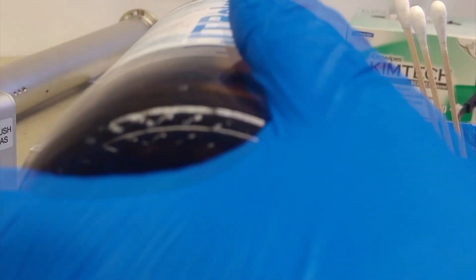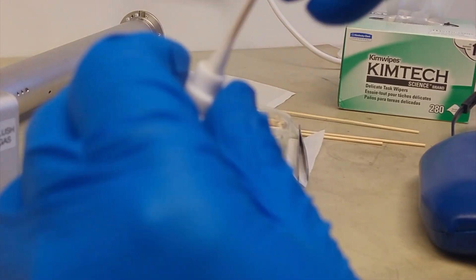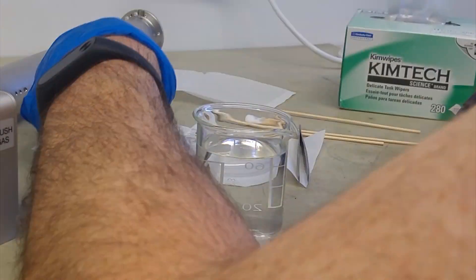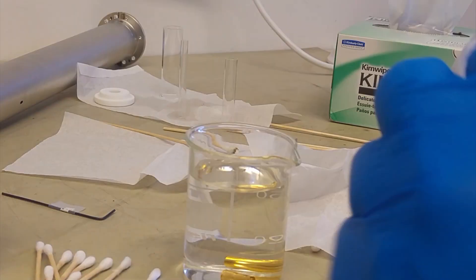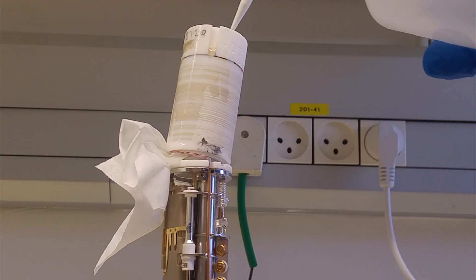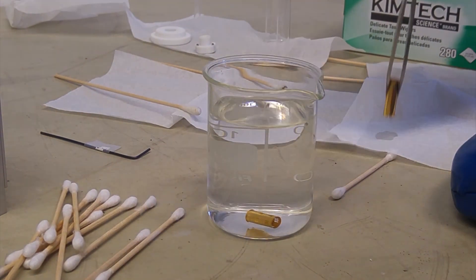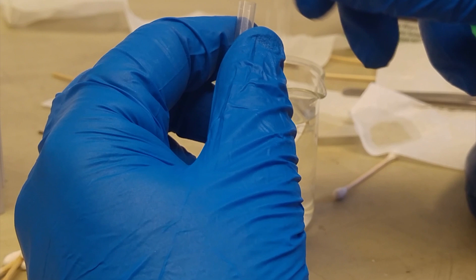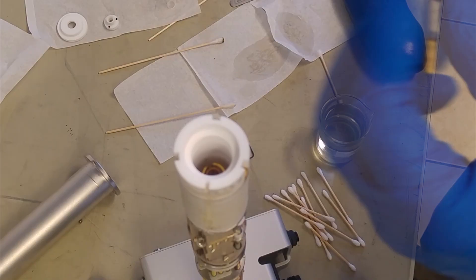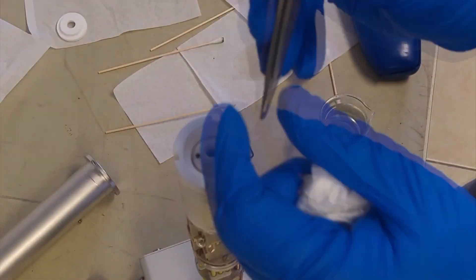The ceramic caps and the inner quartz tubes were removed carefully. One of the caps was quite dirty and was cleaned with a cotton bud and ethanol. All the parts were cleansed with ethanol. The inner tube has metal parts that shield the extremities of the sample from excitation. The coils were rinsed with ethanol without touching them. The top of the probe was cleaned and all the parts were air-dried. The sensor tube was reassembled — the lower piece of metal inside and the upper part outside, left close to the top. The ceramic cap will push it into the precise position.